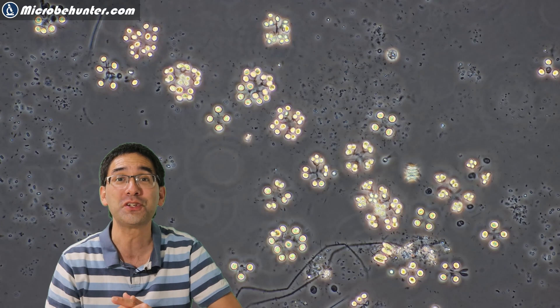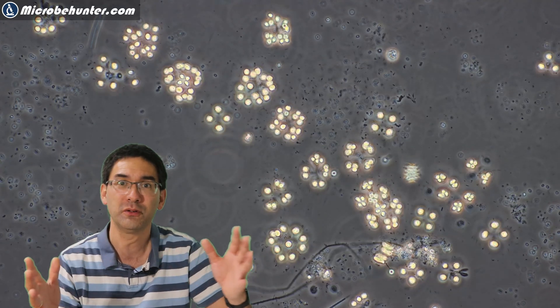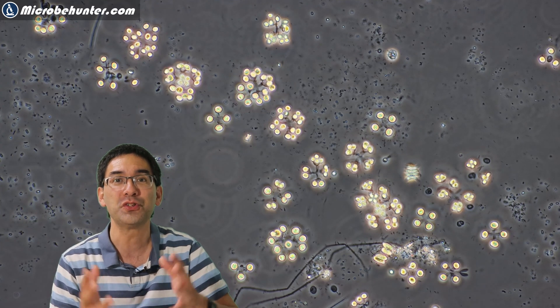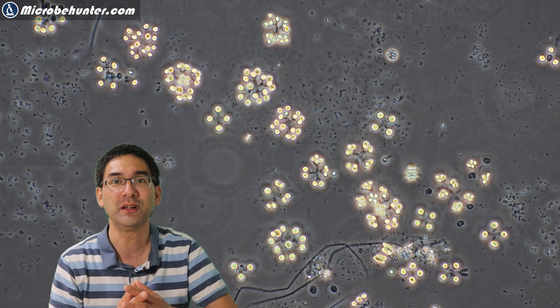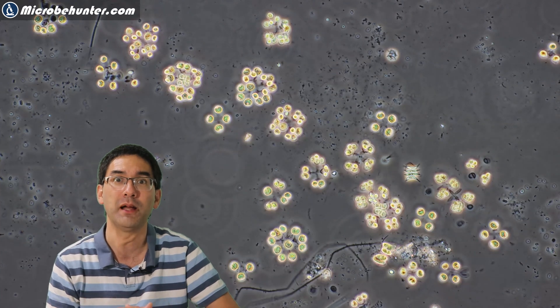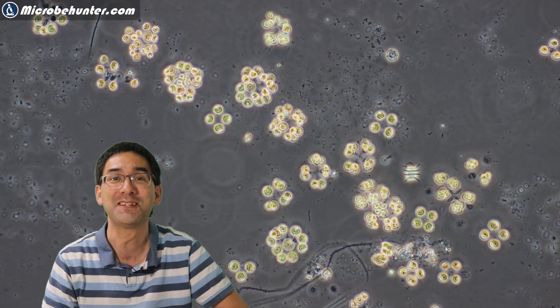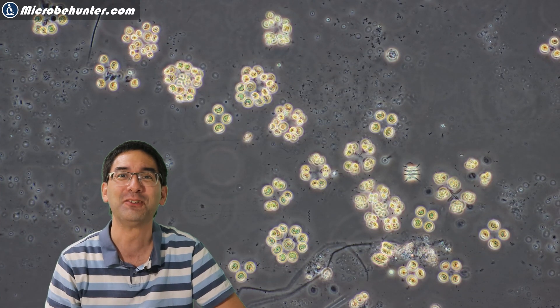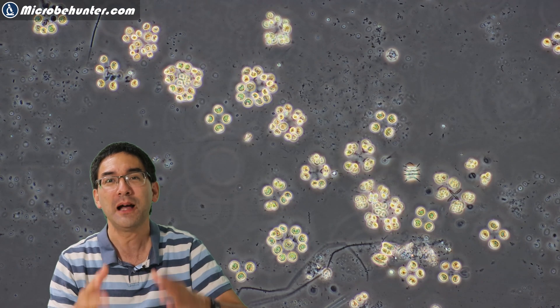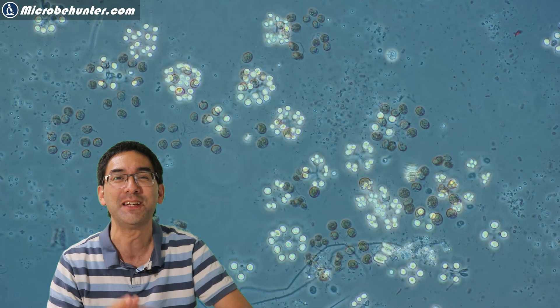The bacteria of course are moving around — some of them are motile — and are of course significantly smaller. I'm already stumbling over my own tongue, but I'm not going to edit it away, I'll just leave it as it is.